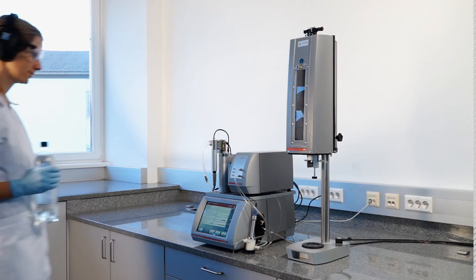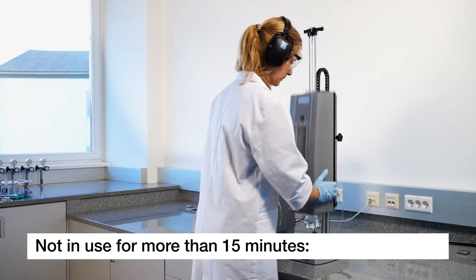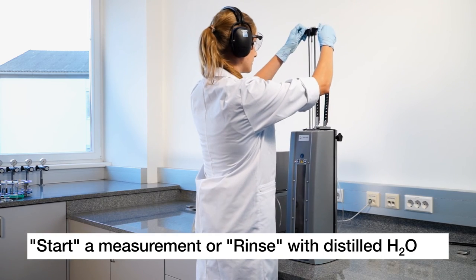In case you are not using your PBA system for more than 15 minutes, please fill distilled CO2-free water either by starting a measurement or by the service utility called Rinse.